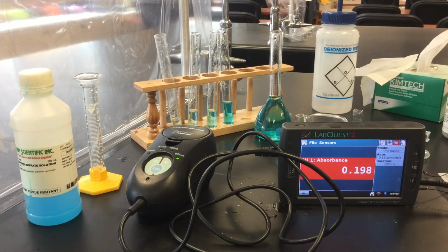All right, so after you make your calibration curve, your Beer's Law curve, with the 4 diluted solutions, you will plot the BB concentration, the copper(II) nitrate from the BBs, on that curve to figure out what their concentration is.